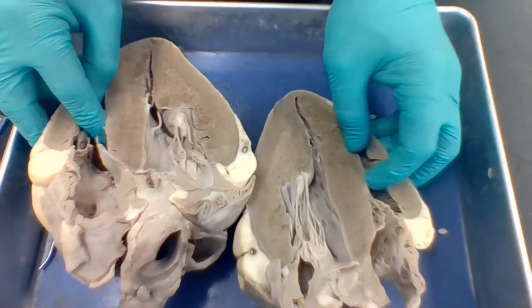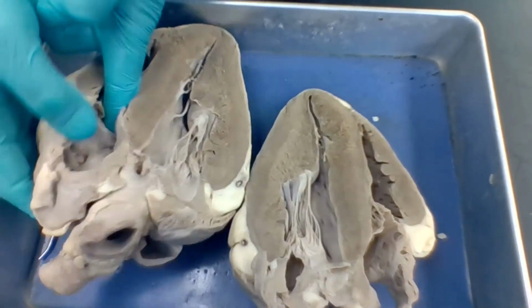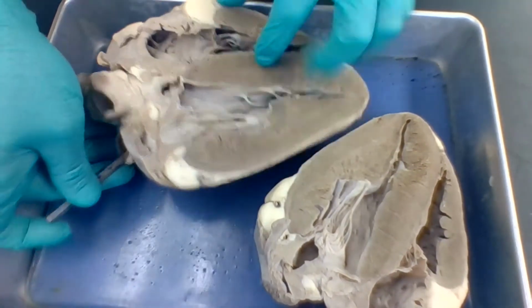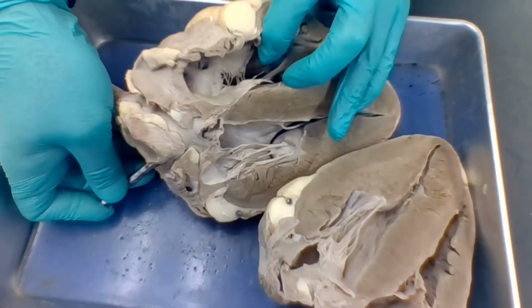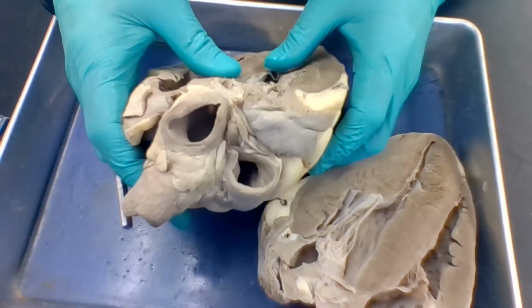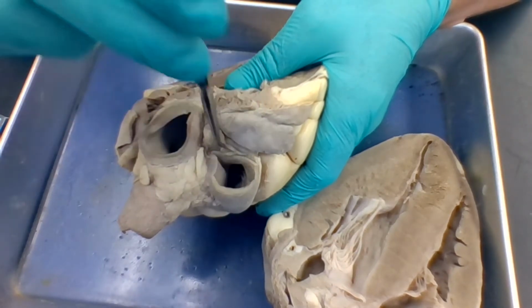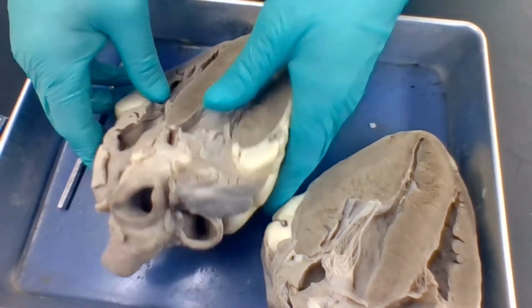It's a one-way valve. So the right ventricle is going to contract, and that's going to force the blood out through the pulmonary trunk. And you can see here, this is all connected, right? See that? Okay, so out the pulmonary trunk. Now inside of the pulmonary trunk, I'll try and get you a good view here. Inside of the pulmonary trunk, there's another valve in there. And that's called the pulmonary semilunar valve. And that's one way, okay?